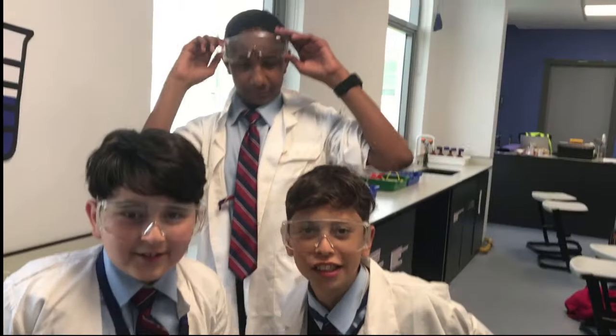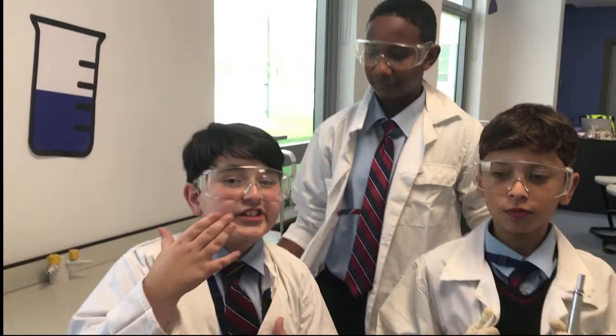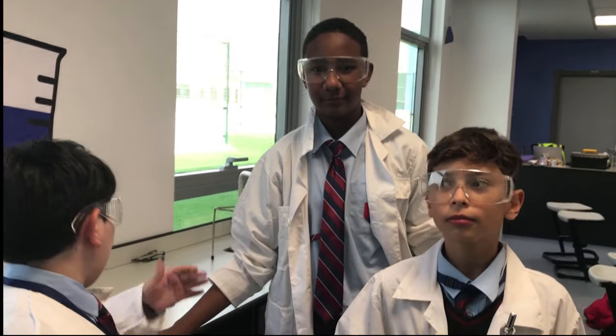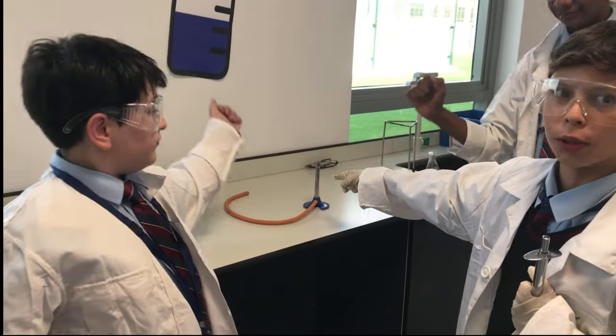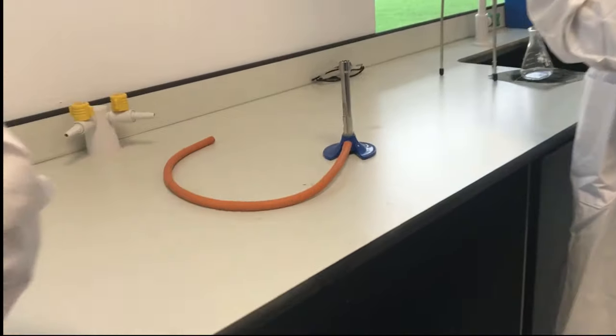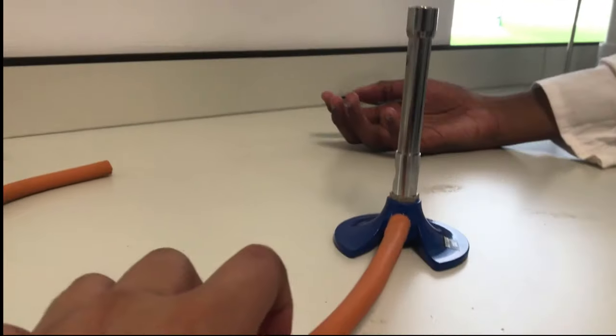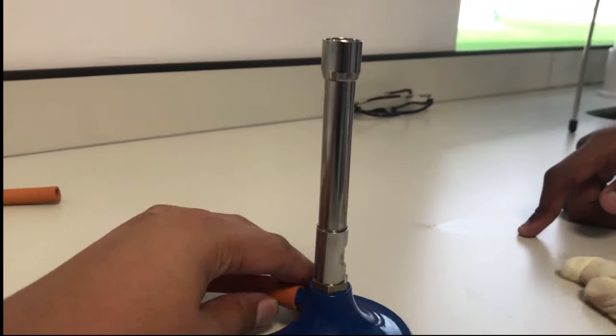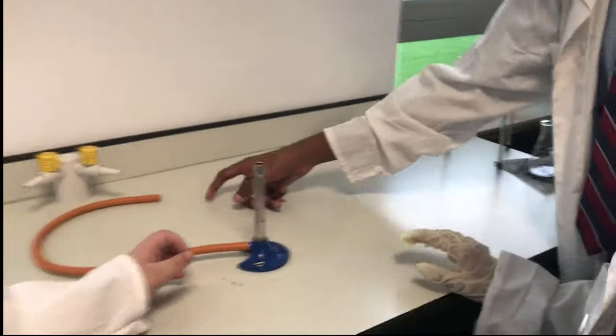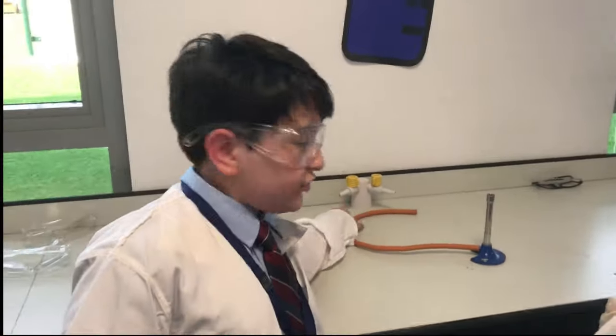Oh hi there, fleshy mammals! We are students from GFS and today we would like to show you how to use the Bunsen burner. If you can close up Mr. Cameraman, you can see the Bunsen burner. Please look at this part.